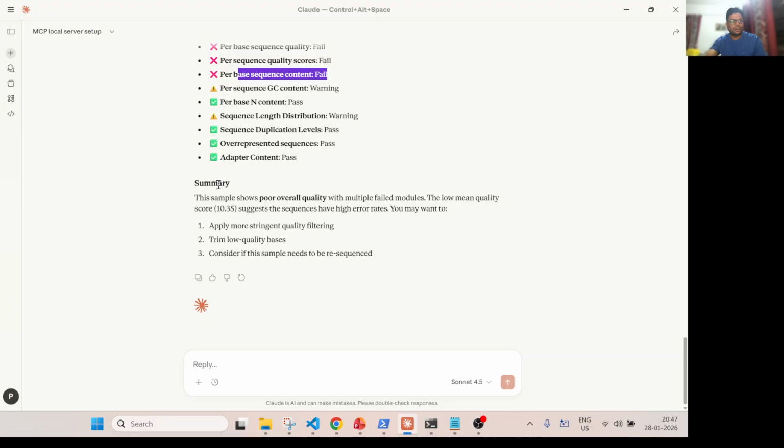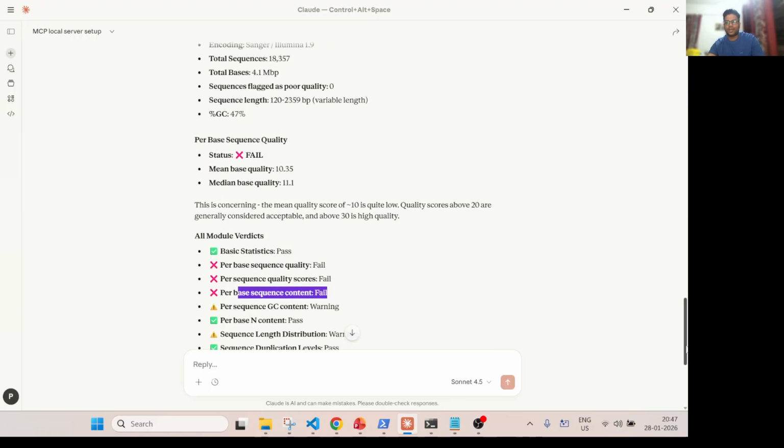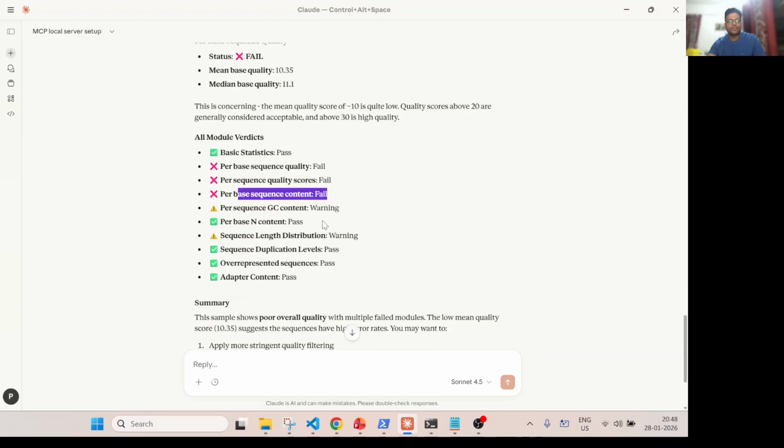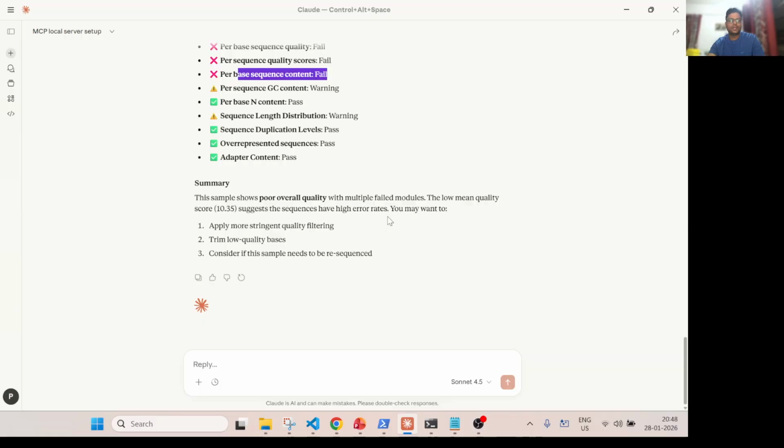Now Claude Desktop is able to do the QC analysis locally, right? And it's very intelligent also. Based on this information, you can further empower this Claude Desktop, particularly this Claude AI assistant, to follow this process using skills. So skills is the next advanced concept, another concept where you document how a FastQC quality check should actually be done by an agent. So we document that.